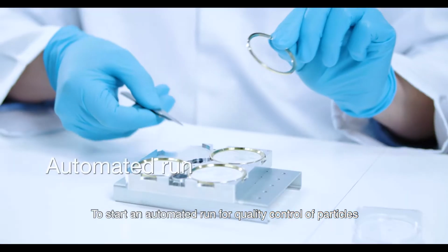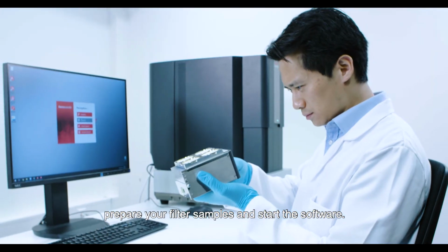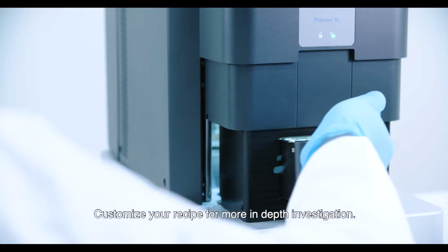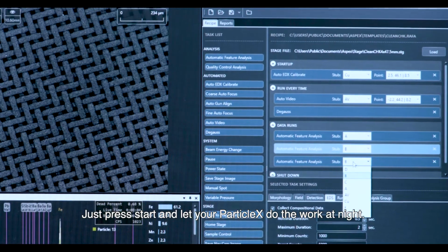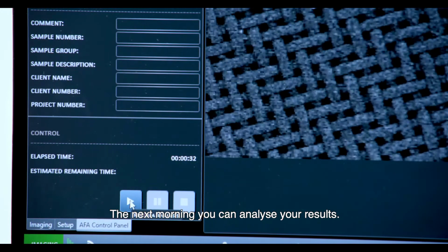To start an automated run for quality control of particles, prepare your filter samples and start the software. Customize your recipe for more in-depth investigation. Just press Start and let your ParticleX do the work at night. The next morning, you can analyze your results.